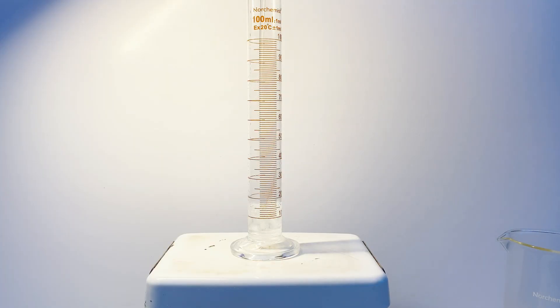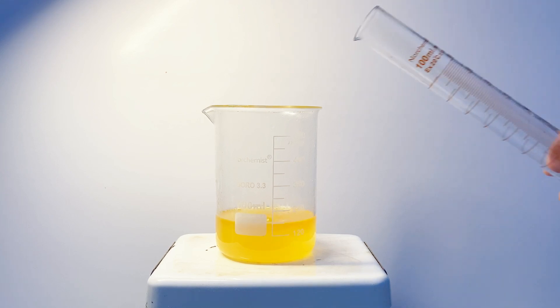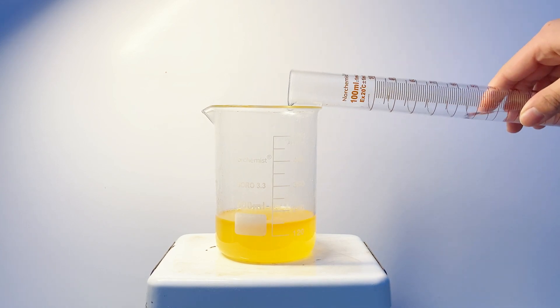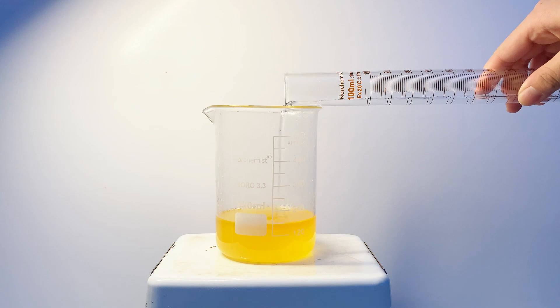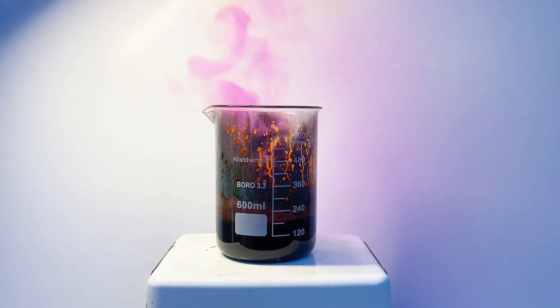Here's where I made a mistake. Maybe because of the freezing temperatures outside, I had my hot plate on medium heat, which was a pretty bad idea because the reaction is already really exothermic, and this could promote the sublimation of the iodine. I also added a bit too much of the peroxide at once, causing a bunch of the iodine to form very rapidly, resulting in a quick color change and a huge plume of purple smoke.